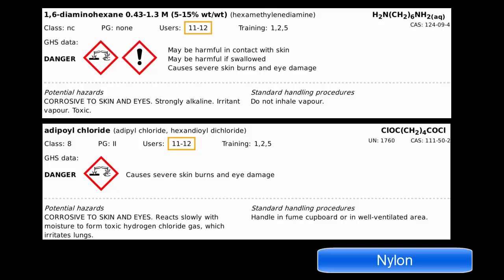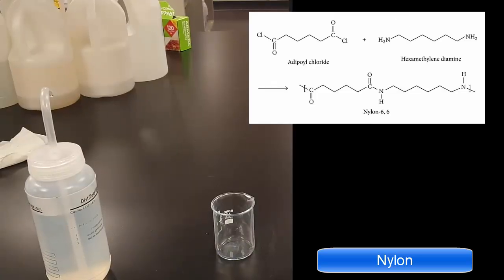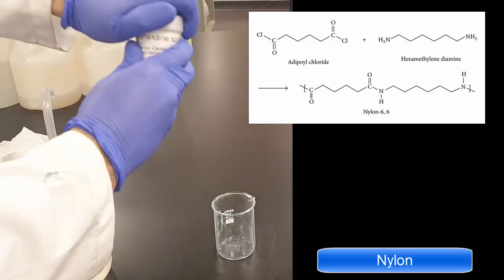Now, we're trying to get away from doing a lot of the toxic organic reactions, and nylon's one of them. So you can see that both products there are quite toxic. And so ideally, we can do this once at a demo, and hopefully you can get a better picture because you can see it clearly with the video anyway.